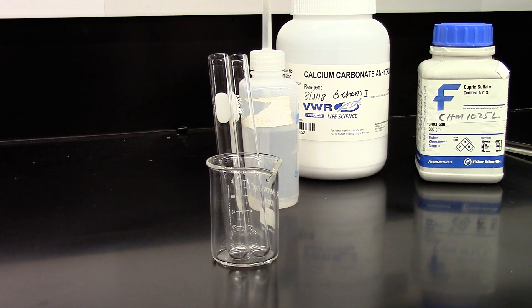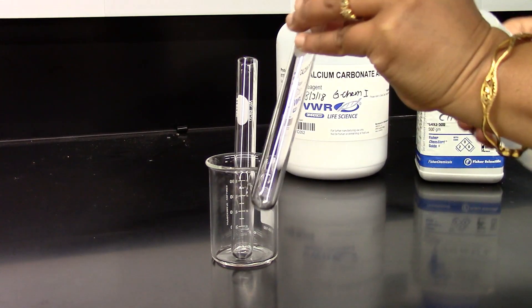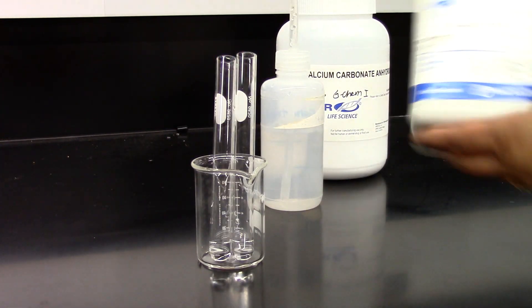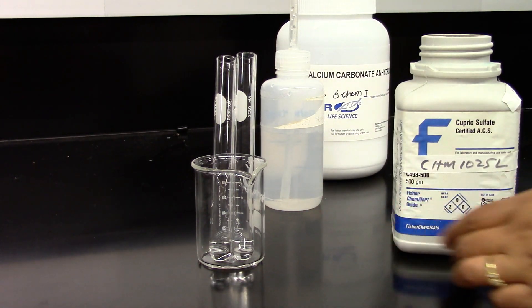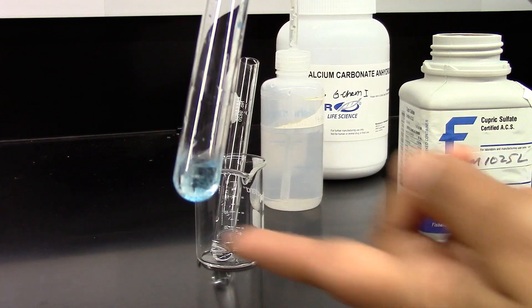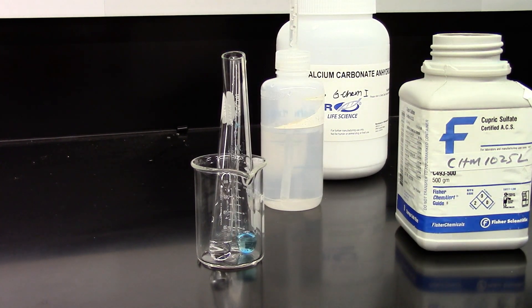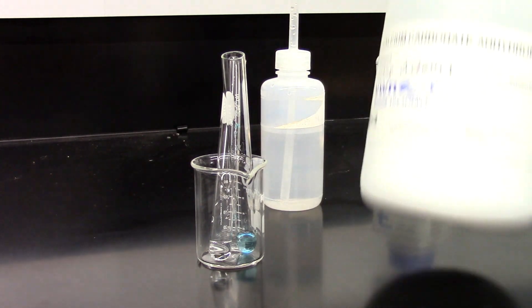I have two test tubes and I am going to add some DI water in each test tube, about 20 drops which is about 1 milliliter. In one test tube I am going to add copper sulfate and give it a mix. Then in the other test tube I am going to add calcium carbonate.